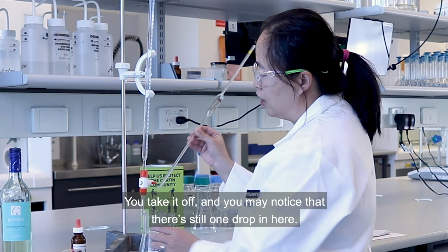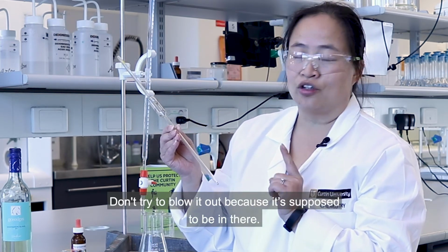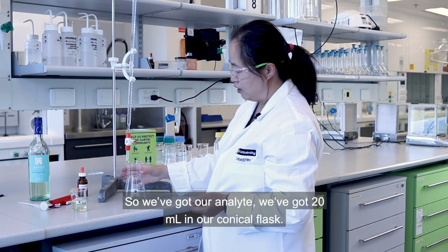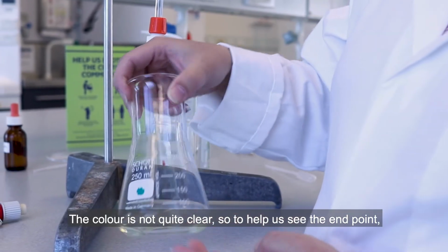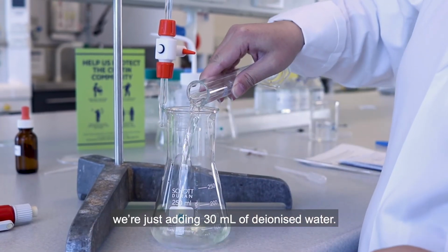You take it off, and you may notice that there's still 1 drop in here. Don't try and blow it out, because it's supposed to be in there. So we've got our analytes. We've got 20 mils in our conical flask. The colour is not quite clear. So to help us see the end point, I'm just adding 30 mils of deionized water.